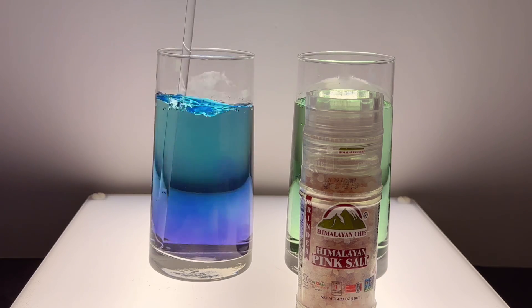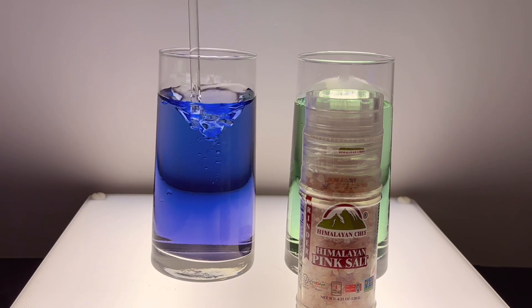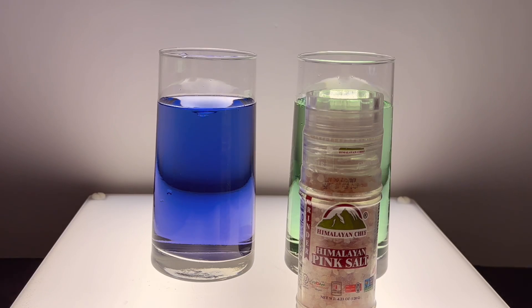Sure enough, when I added the dipotassium phosphate, I saw a shift to a blue or violet color indicating high pH or alkaline conditions.